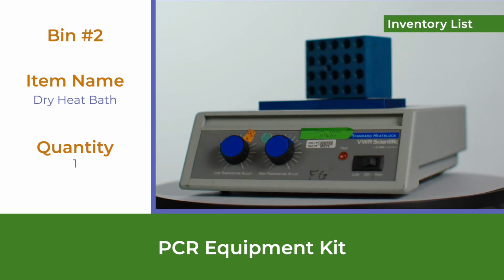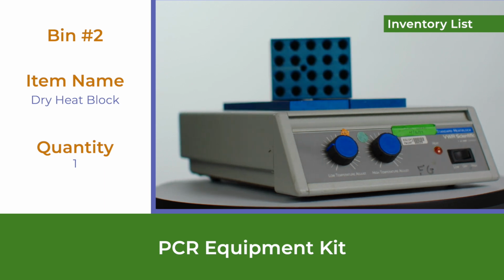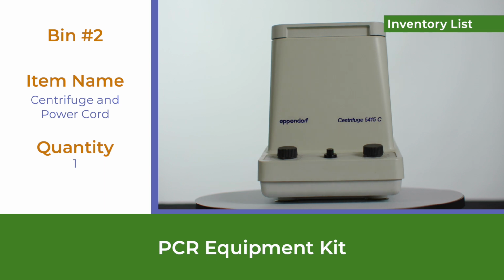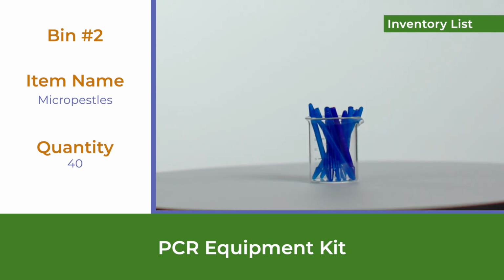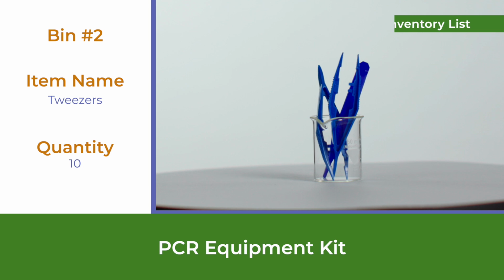In bin 2, you will find 1 dry heat bath, 1 dry heat block, 1 thermometer, 1 centrifuge and power cord, 20 microtube racks, 20 PCR tube racks, 40 micropestles, 40 cap locks, 10 tweezers.